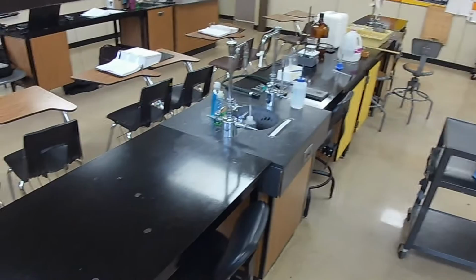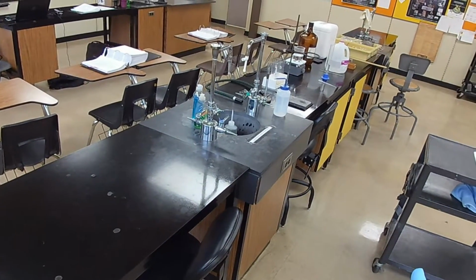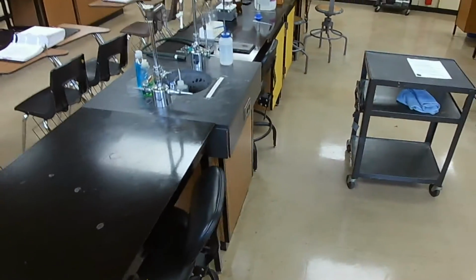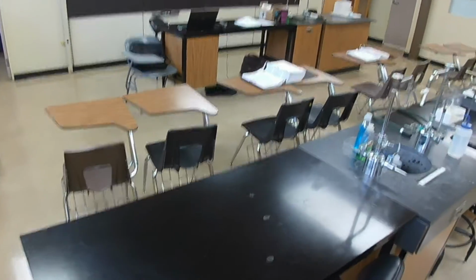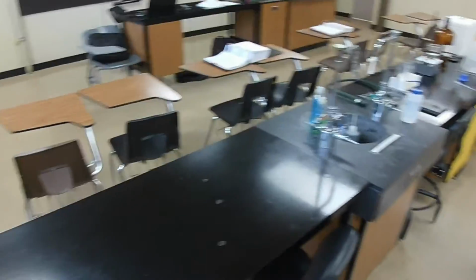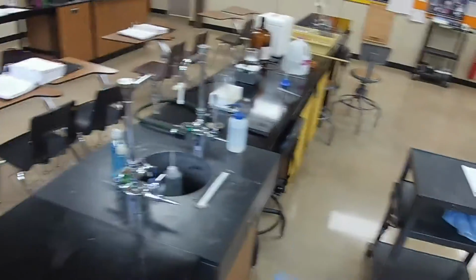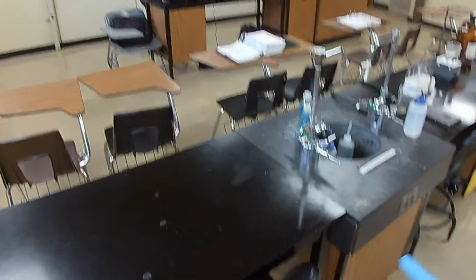28.563. By the way, what do we know qualitatively about the densities of that stopper and probably the zinc? We know that if an object is less dense than the liquid in which it is submerged, it will float. So since the rubber stopper sank and this zinc pellet is probably going to sink, their density should be greater than 1, greater than water.